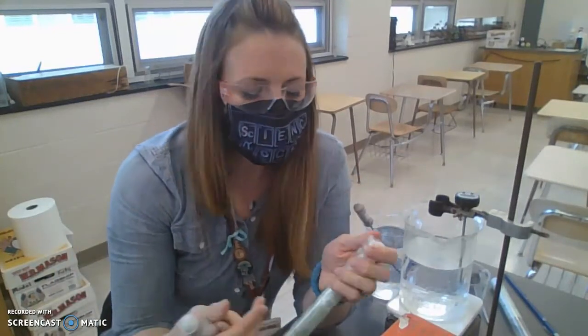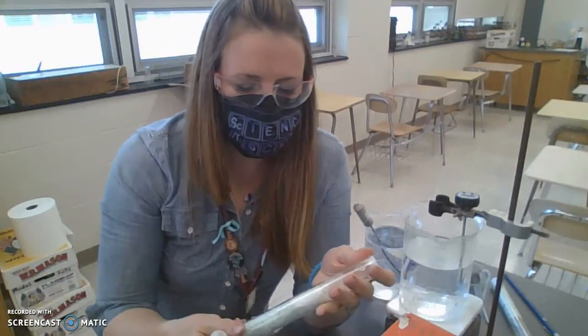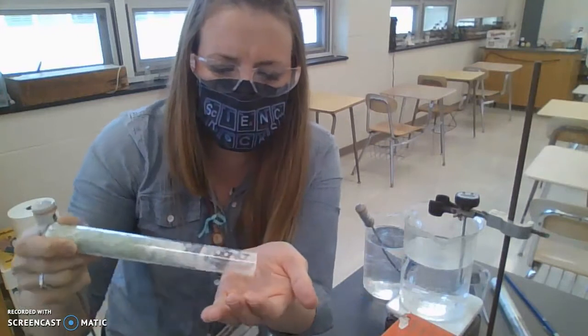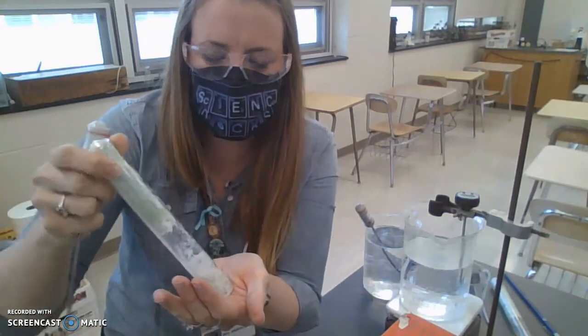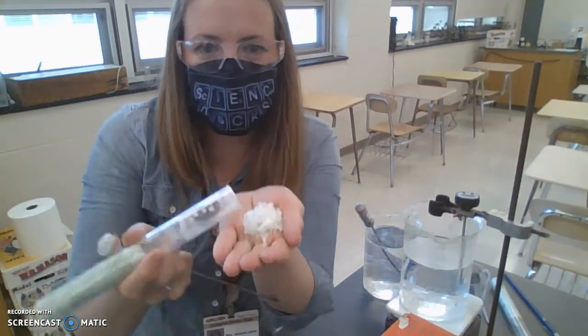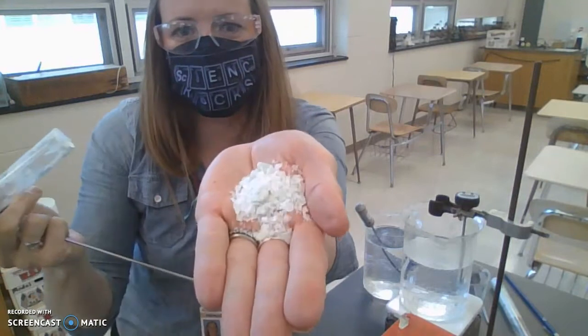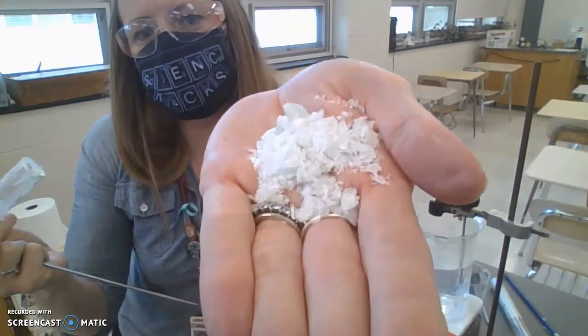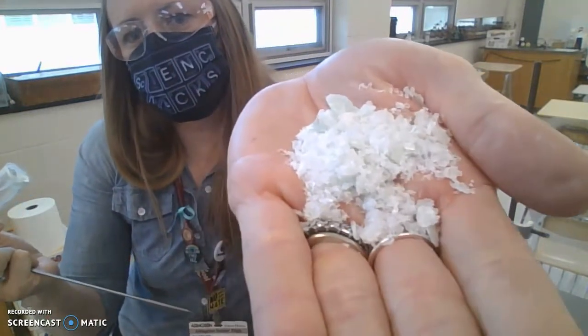Hi everybody, this is our class, and what we're doing is the lauric acid lab. I'm going to show you some lauric acid and we're going to be determining the melting and freezing point of it. Right now it is this white, crystalline powder.